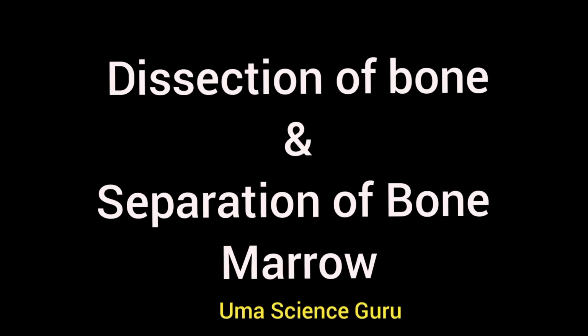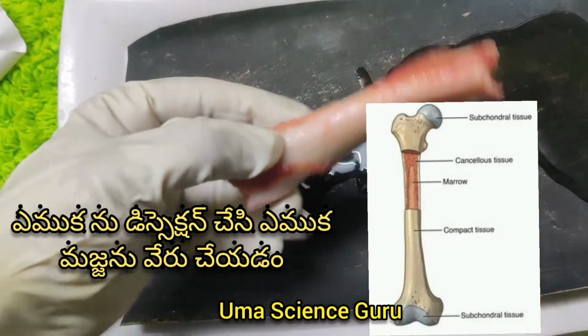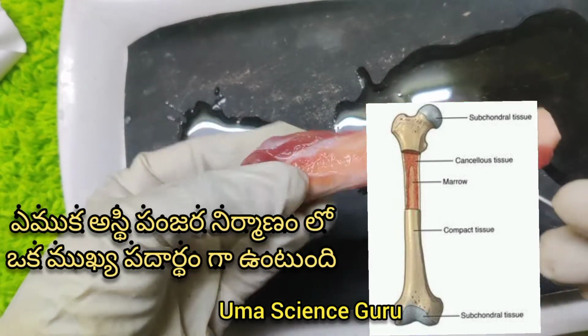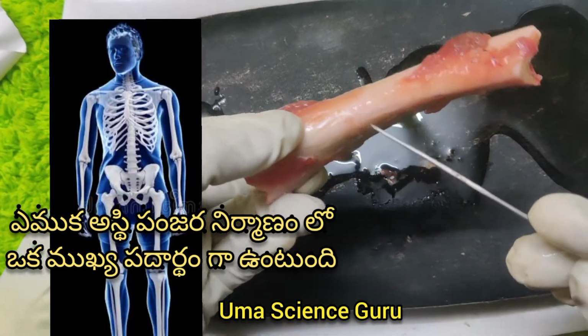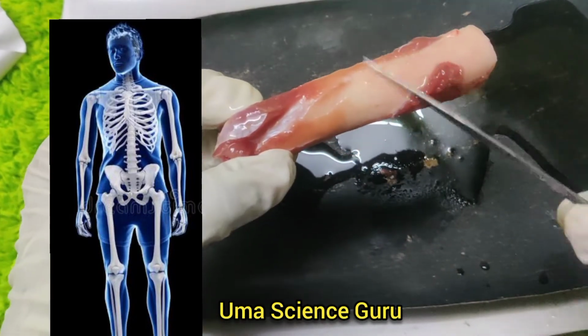In this video, let us do the dissection of bone and separate the bone marrow. Students, do you know about the bone? Bone is a hard, dense connective tissue that forms the most of the skeletal system. Observe the bone. It is very hard.